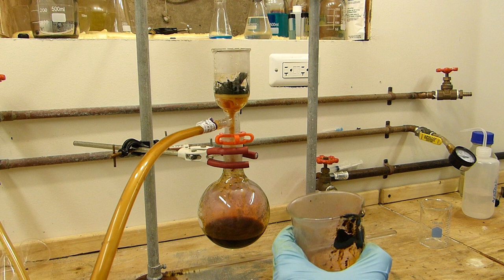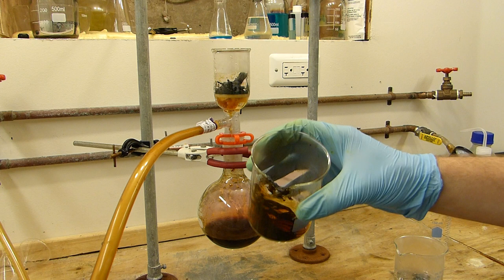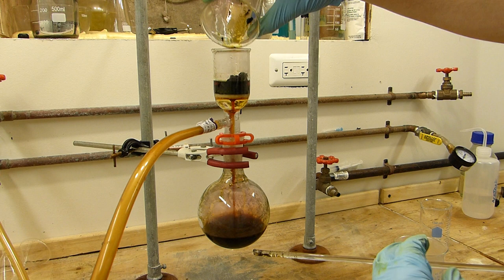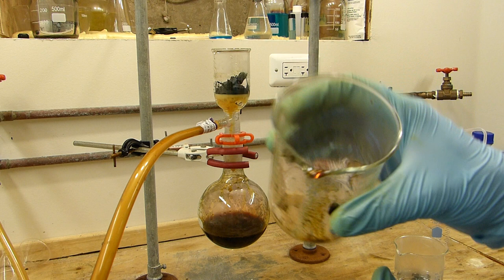Okay and when you have a little bit left you can go ahead and rinse everything with the cold water. First the beaker. We'll use the cold water to repeatedly wash the remaining iodine out. There we go. And maybe one more rinse for good measure. You can see we only have a little bit left.